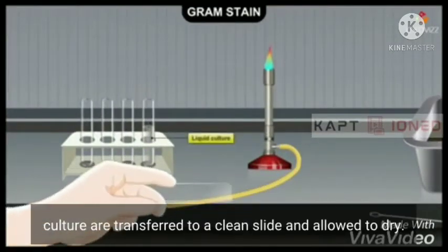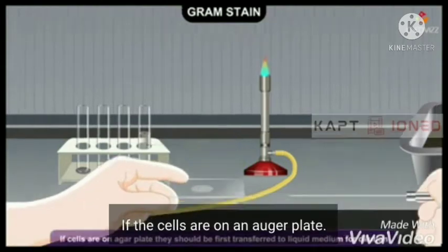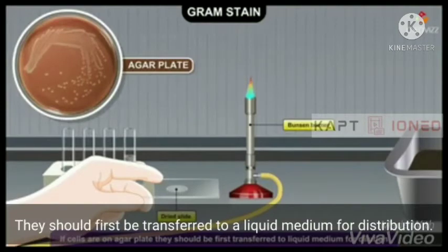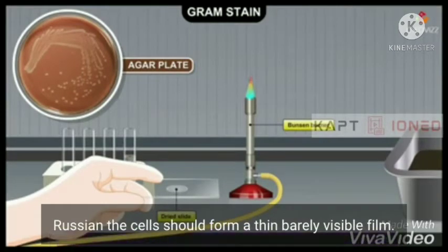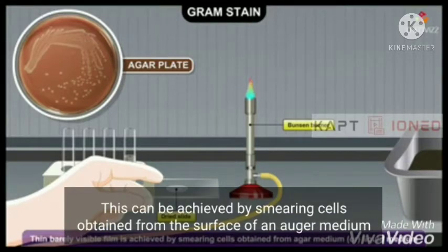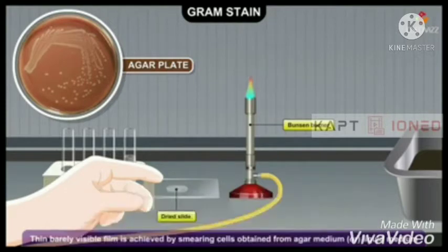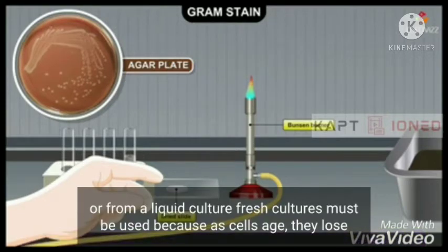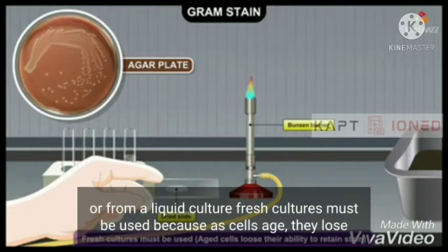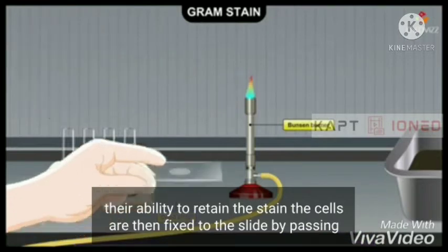The cells are allowed to dry on the slide. If the cells are on an agar plate, they should first be transferred to a liquid medium for dilution. The cells should form a thin, barely visible film, achieved by smearing cells from the surface of an agar medium or from a liquid culture. Fresh cultures must be used because as cells age they lose their ability to retain the stain.